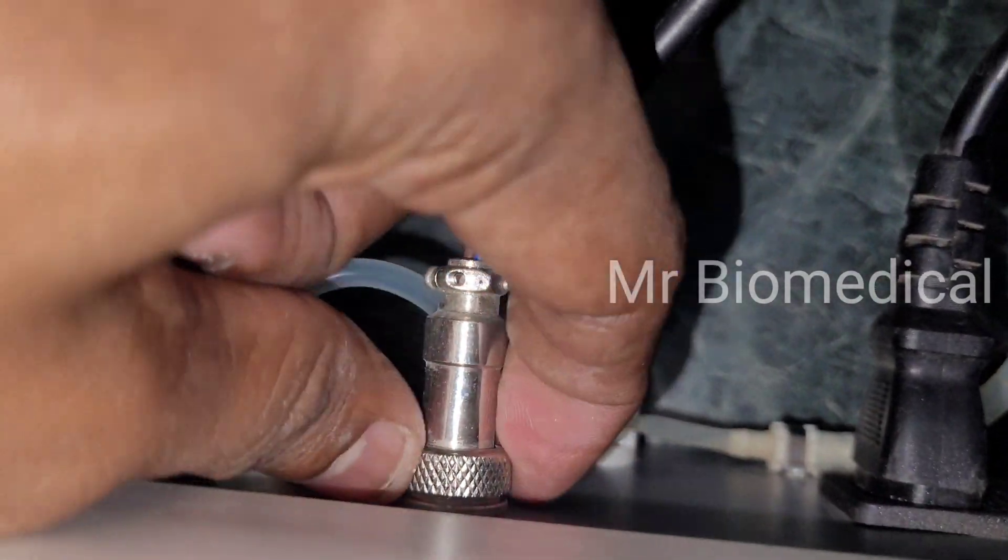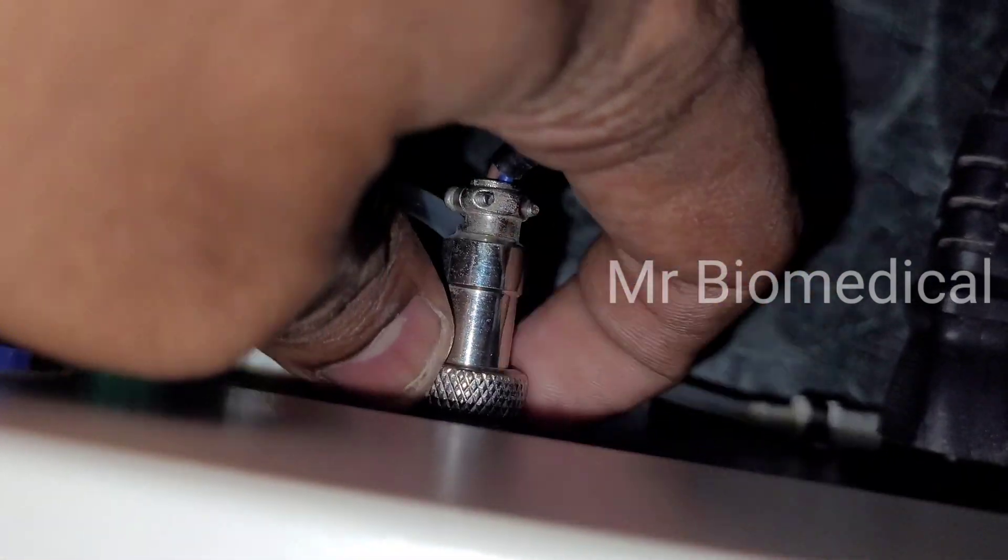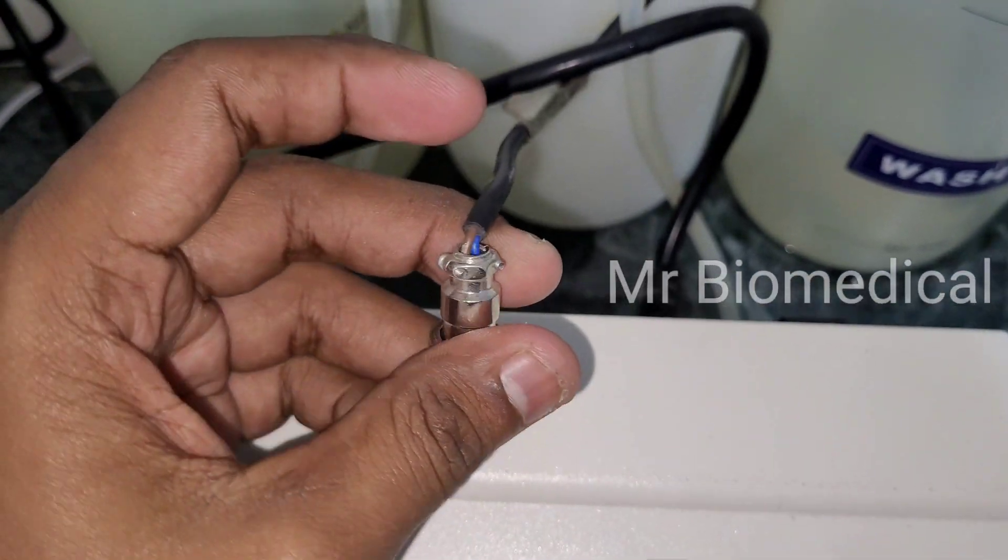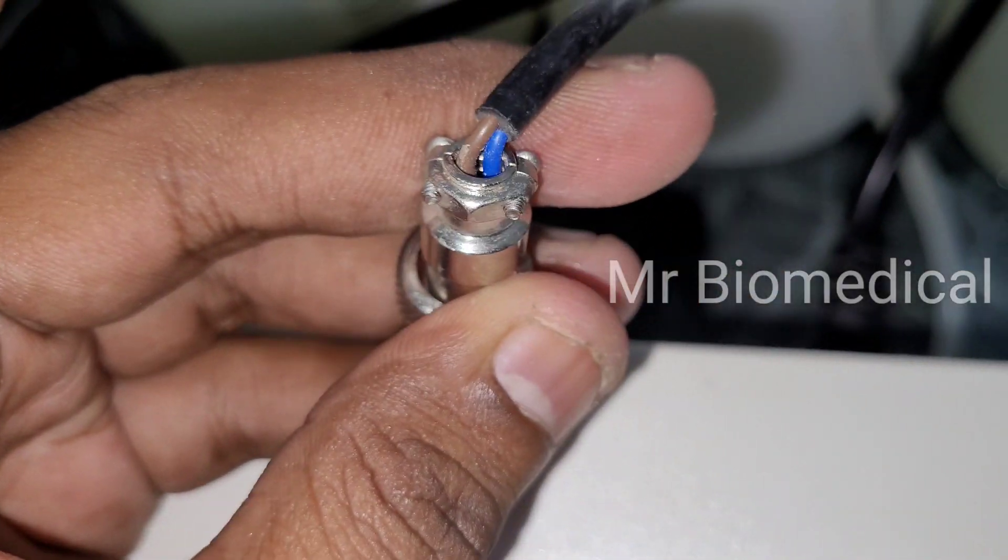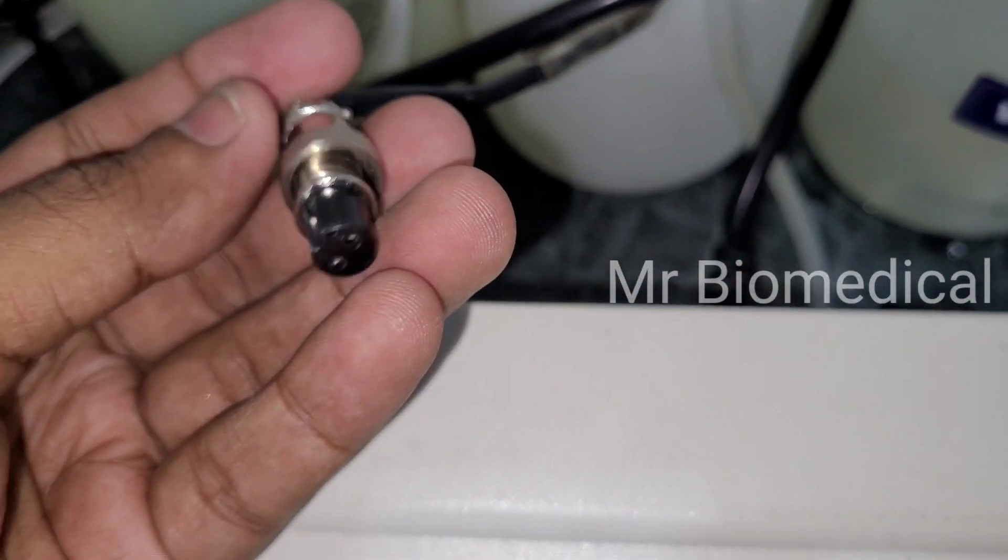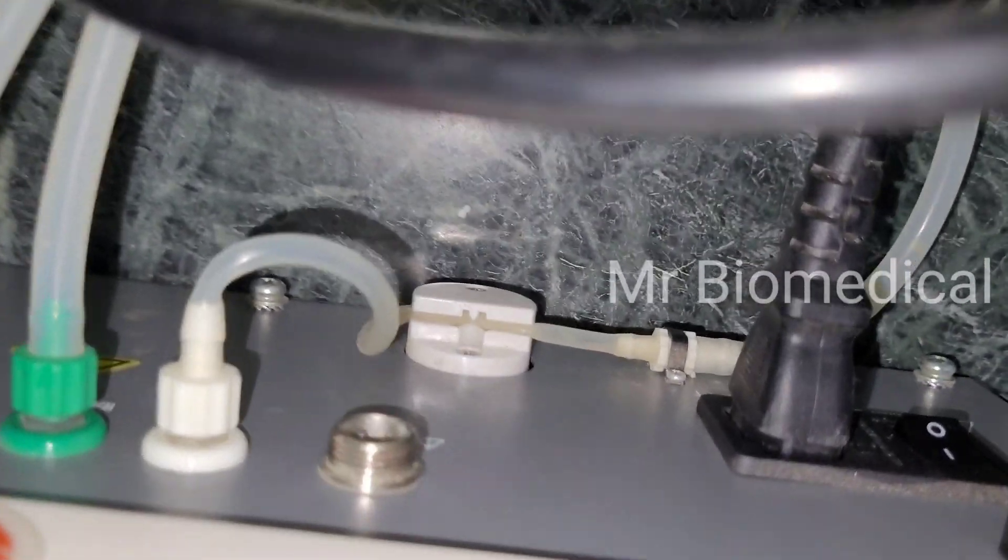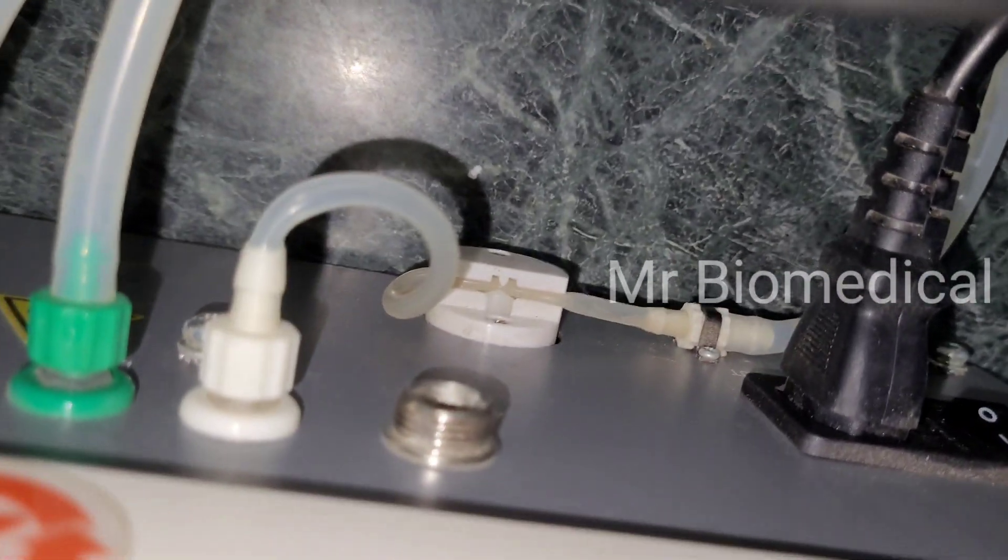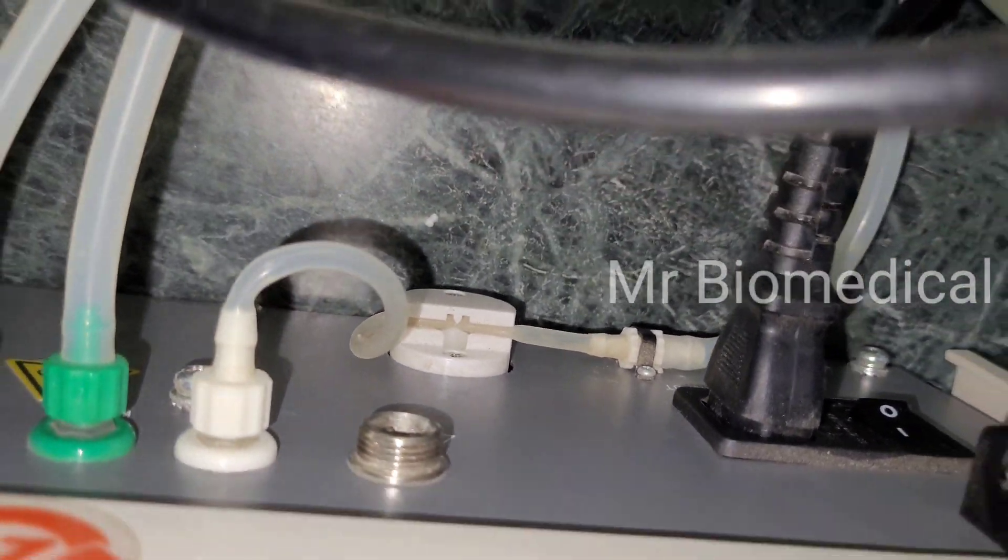At first I want to check the DC motor so I'm removing the connectors. Sometimes the bad connectors will be making this problem, but in this case the connector is fine and we will check the output of the DC here, this pin as you can see.